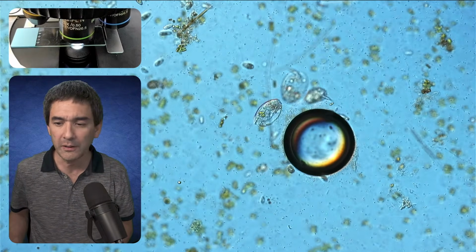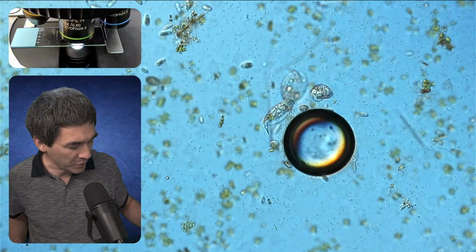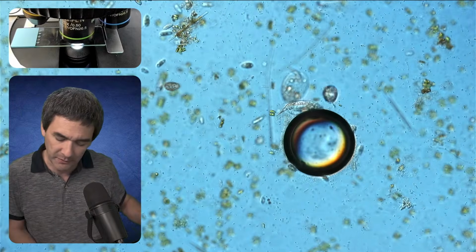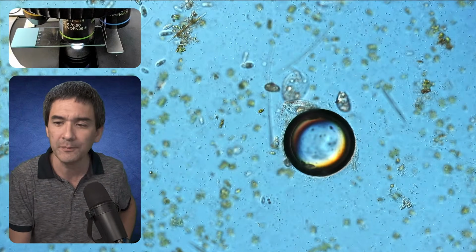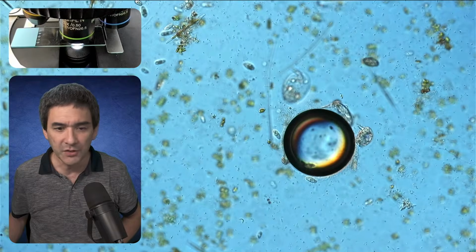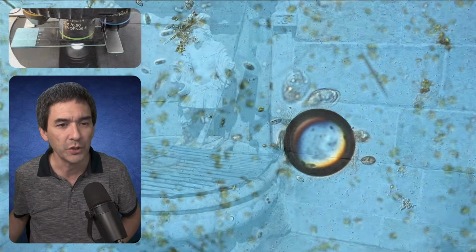show you two short videos of where I collected my other water samples, and I only looked at one of them, so it's going to be also a little bit of a surprise for me, but I was able to find already some larvae here. So I'm going to show you now a short video, just to show you a little bit.